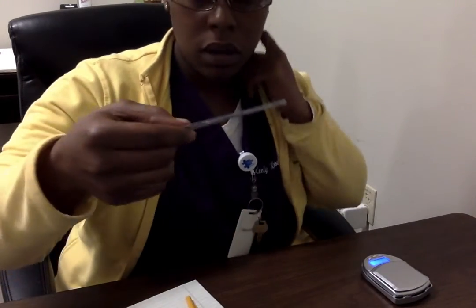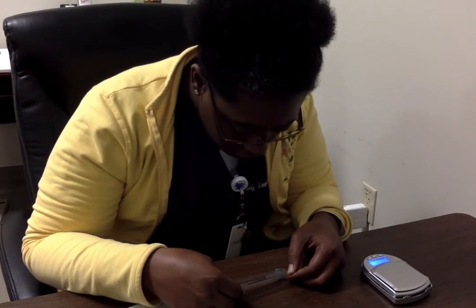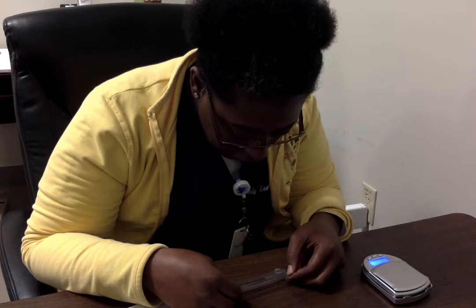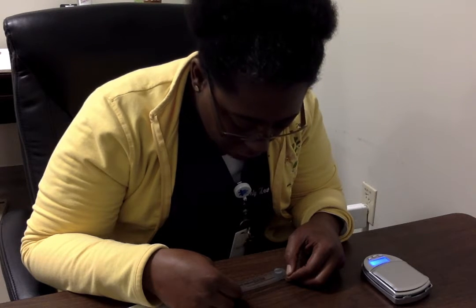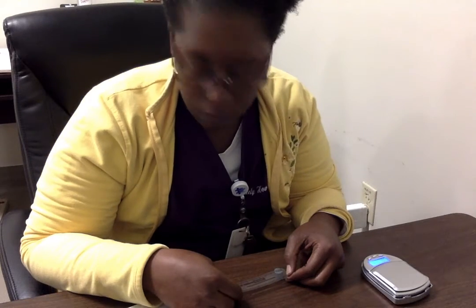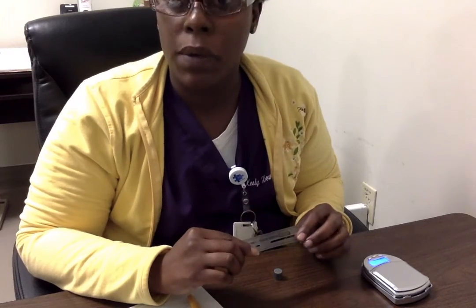Okay, so moving right along to step 3, now we're going to measure the diameter. So we're going to start with our silver. Make sure you can see me there. And with this measurement, you want to make sure that the line is just your best educated guess. And I'm getting actually about 1.2. But step 3 also says to round your answers. So we're going to go with 1. Round down.